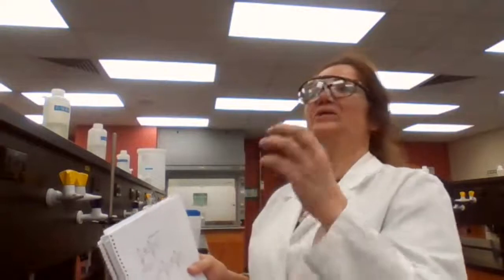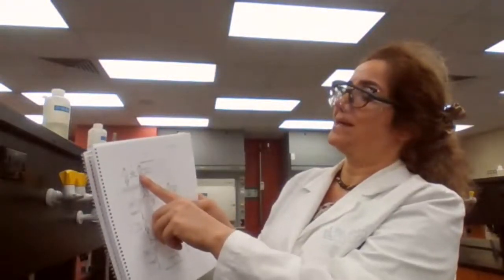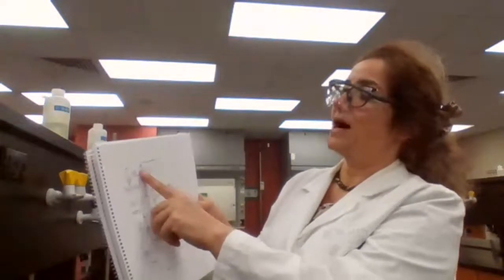So first, if you have a mixture of a neutral compound with the acid, you add your extracting agent. Because they are organic compounds, both of them dissolve in the organic layer. Then you add your sodium hydroxide. It would selectively react only with the acid and bring the acid to the aqueous layer. So now the top layer, which is the organic layer, is going to have the neutral organic compound. The bottom layer is going to have the salt of the acid, and now you can separate it.